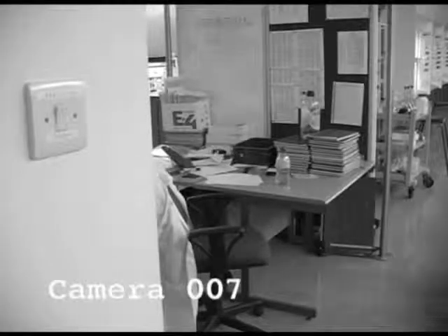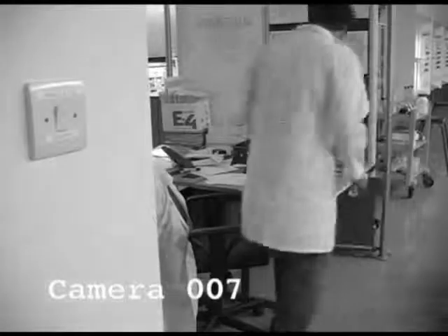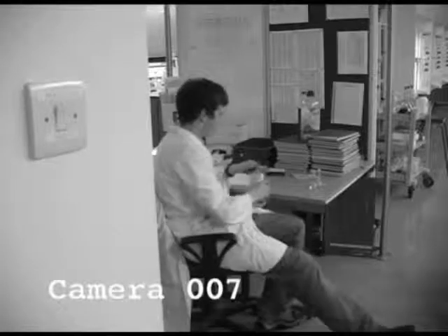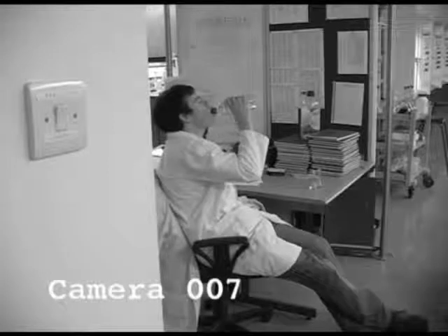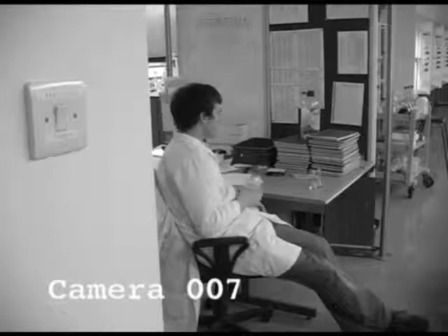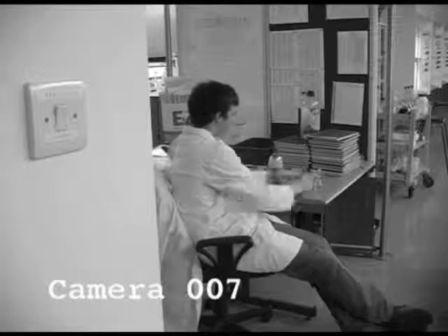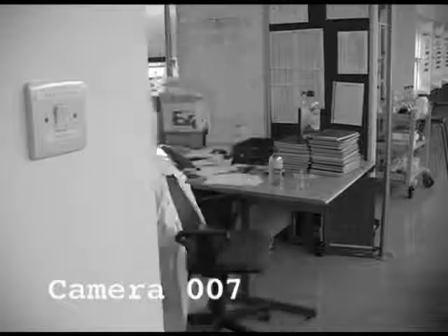And then, if we look at the end of the lab, here you come with your experiment. It wasn't toxic, it was absolutely fine. And you leave it on the table and proceed to take a drink without washing your hands. Hardly toxic does not necessarily mean it won't harm you. And you could just have drunk some of it. This is true, yeah.